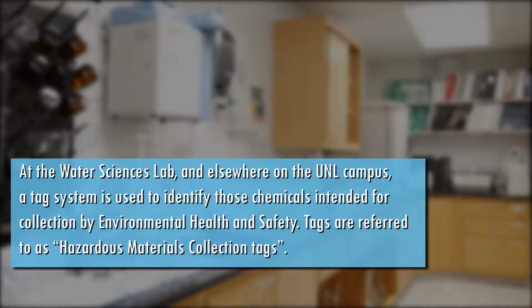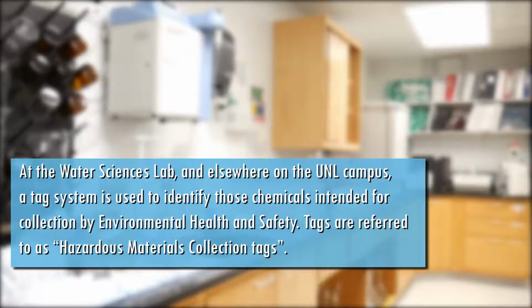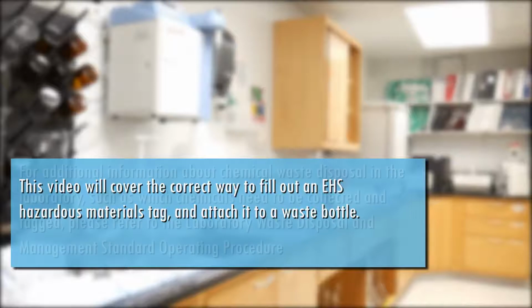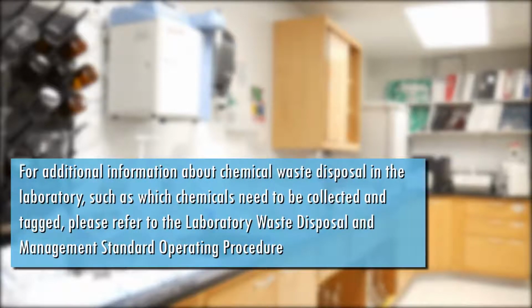At the Water Sciences Lab and elsewhere on the UNL campus, a tag system is used to identify those chemicals intended for collection by Environmental Health and Safety. Tags are referred to as Hazardous Materials Collection Tags. This video will cover the correct way to fill out an EHS Hazardous Materials tag and attach it to a waste bottle. For additional information about chemical waste disposal in the laboratory, such as which chemicals need to be collected and tagged, please refer to the Laboratory Waste Disposal and Management Standard Operating Procedure.